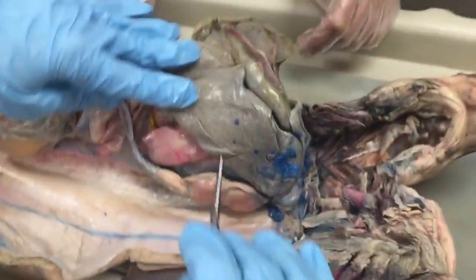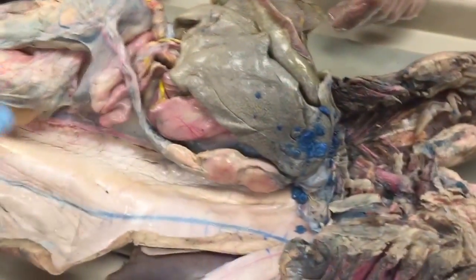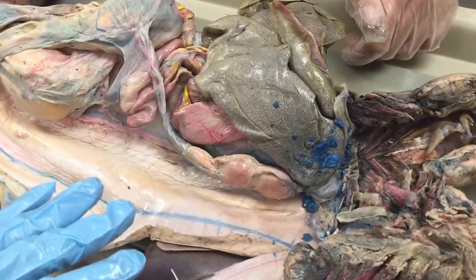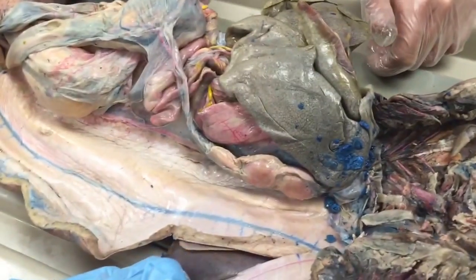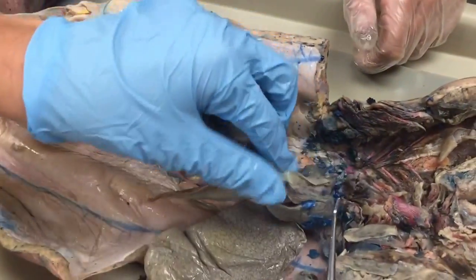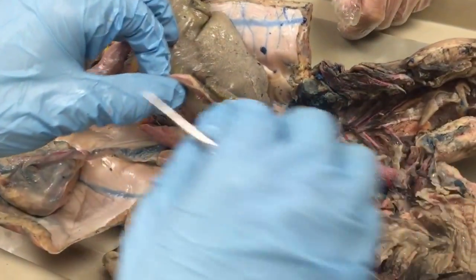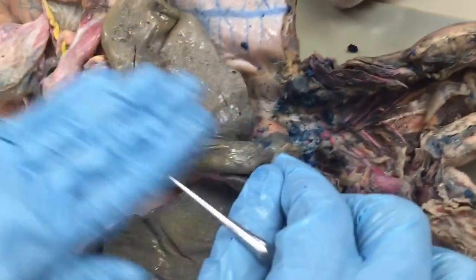Remember, males and females in the embryo stages and even in the younger stages, they all start out the same. But the female develops differently from the male. So the male also has a falciform ligament here that helps hold up the liver and attaches the liver to the body wall.